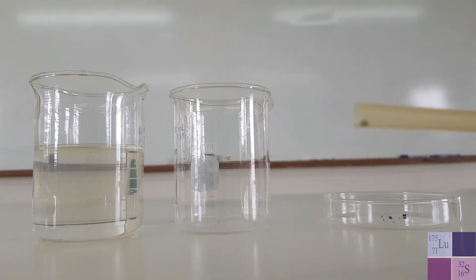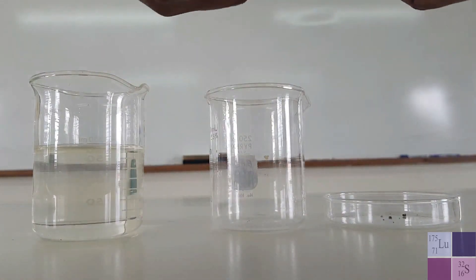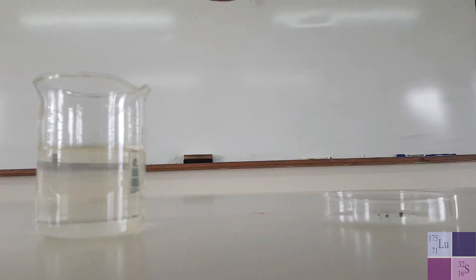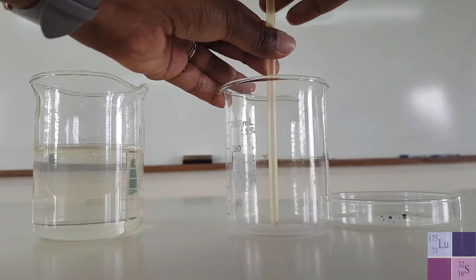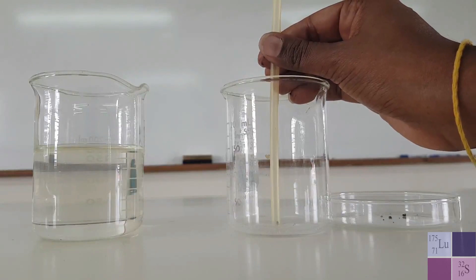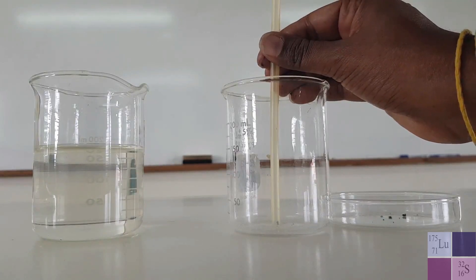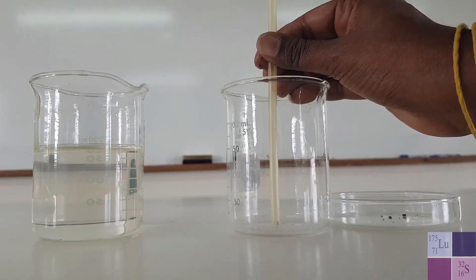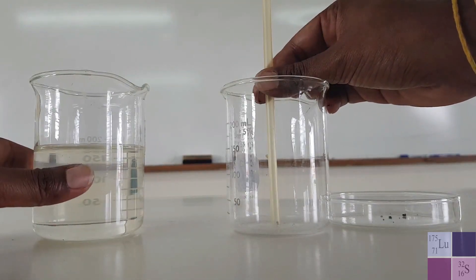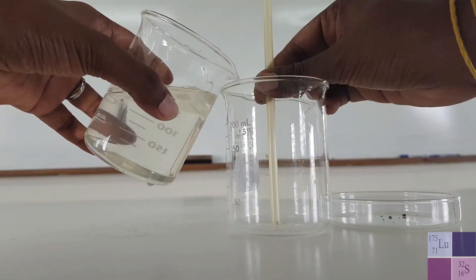We want to put this crystal of potassium permanganate into this empty beaker, but we don't want to remove the straw just yet. I'll take my beaker, ensure the crystal doesn't fall out, put the crystal in with the straw — so you want something looking like this. I'm still holding the straw in place and you can probably still see the crystal at the bottom. The idea is to pour water and hopefully the water doesn't reach the crystal just yet — that will depend on how firmly I hold the straw and whether the bottom of the straw is even. Regardless of the outcome, we should still be able to observe the diffusion of potassium permanganate. So here's a beaker of water and I'm going to gently pour.